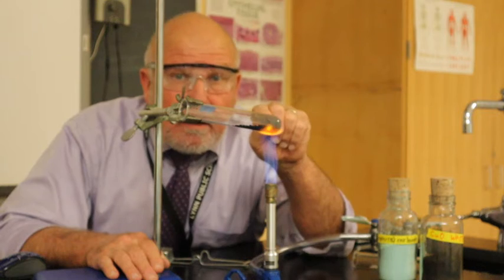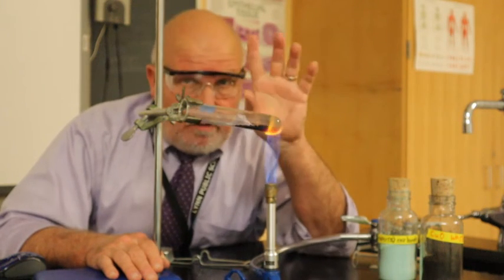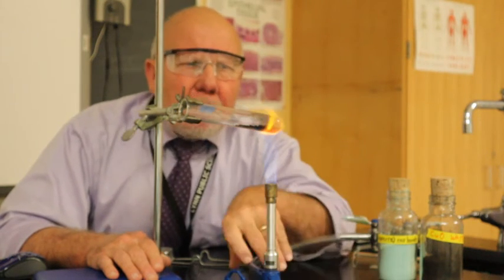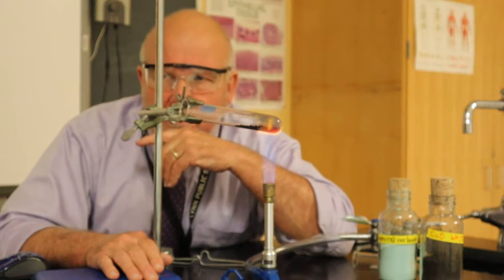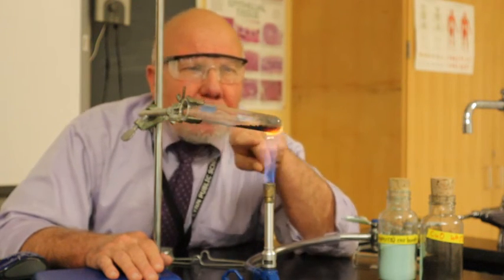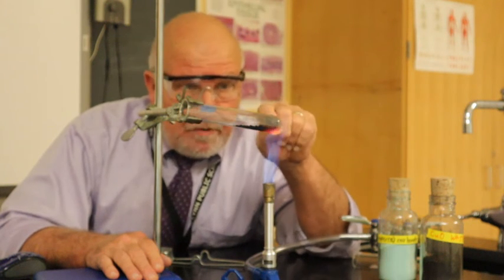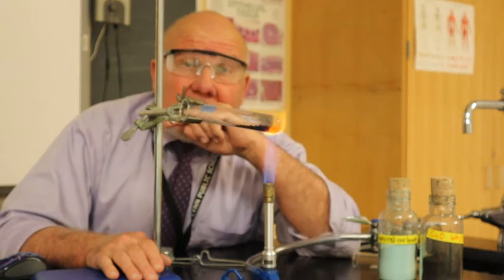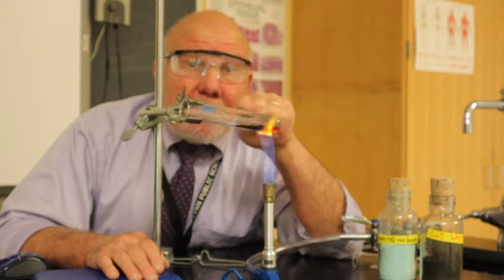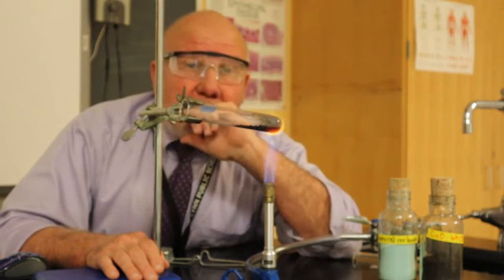Once we have that, we'll know how many grams of this we made, and we can compare what we actually made, which we call the actual yield, with what we thought we were going to make, the theoretical yield, which is the 1.29 grams. So we'll see how we do in terms of our percent. And the formula in your lab sheet tells you how to calculate the percent yield, which is the actual yield, which will be how much we actually made, divided by the theoretical yield, the amount we were supposed to get, which is 1.29 grams. And you multiply that times 100, and you get your percent yield.